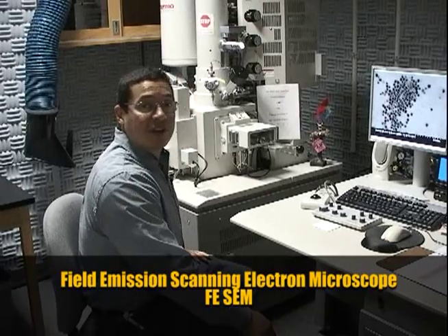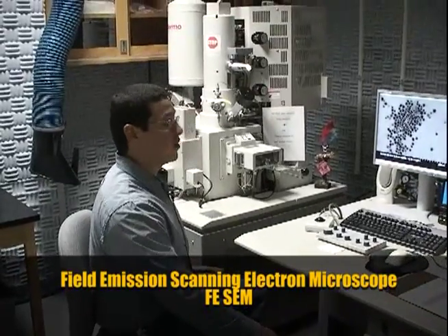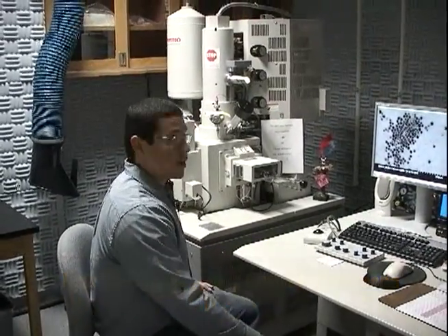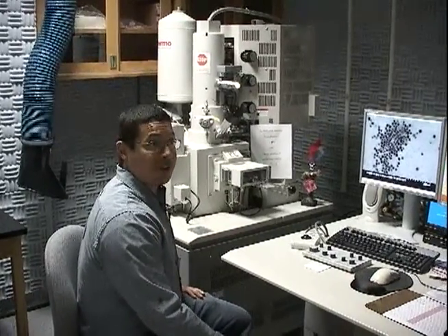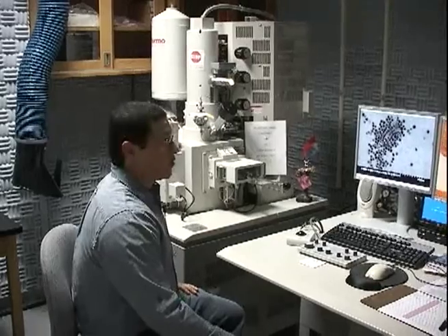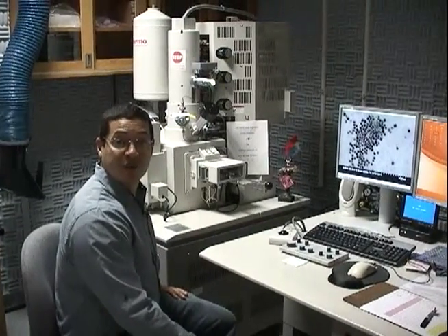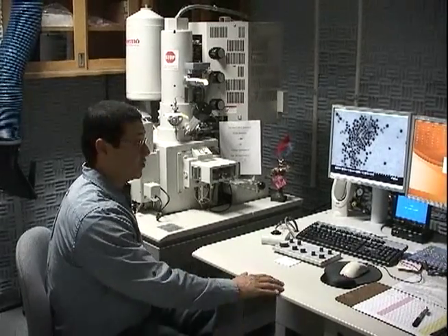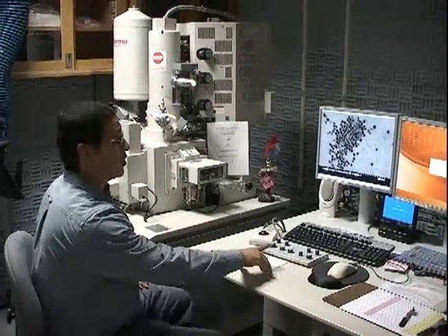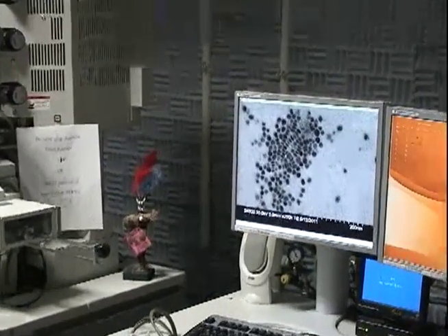One of the techniques we use in characterization is scanning electron microscopy. This is a field emission SEM, which allows us to take images of our nanoparticles with nanometer resolution. Aside from getting sizes from absorption spectra, we can physically see the sizes of these nanoparticles. This is an example of copper zinc tin sulfide nanoparticles, which are slightly larger than our cadmium selenide — roughly 20 to 30 nanometers.